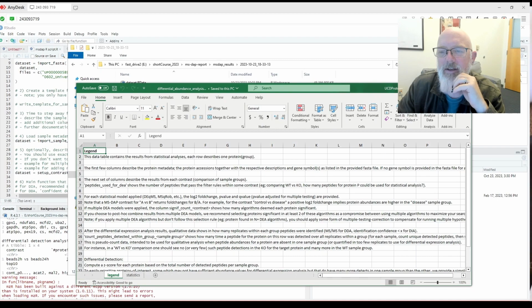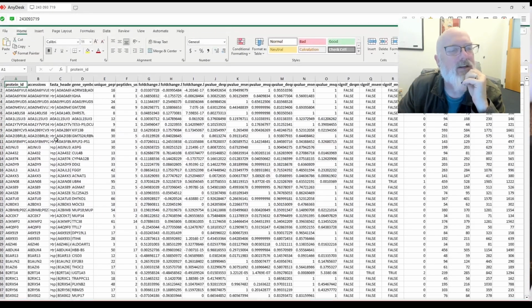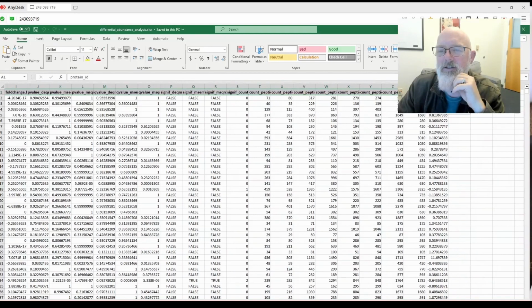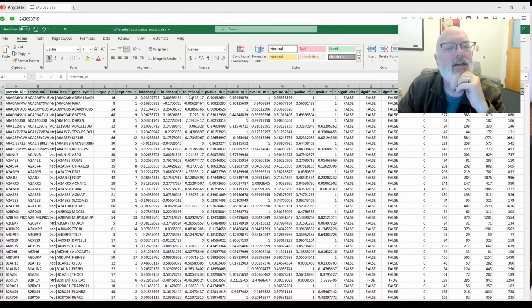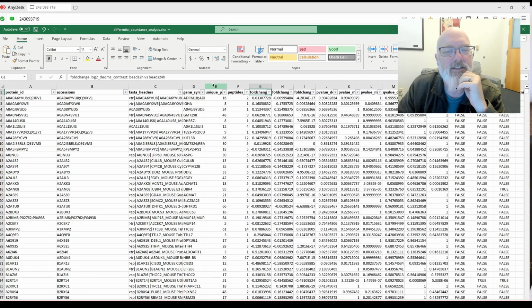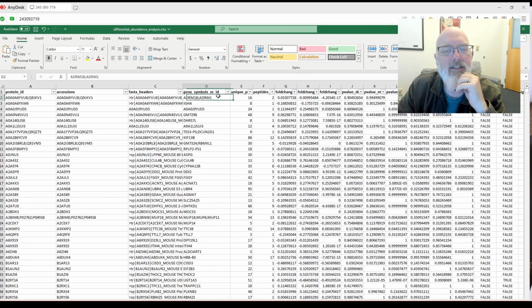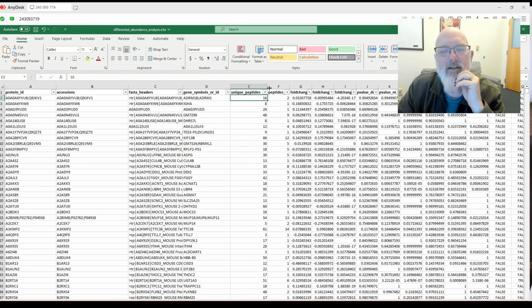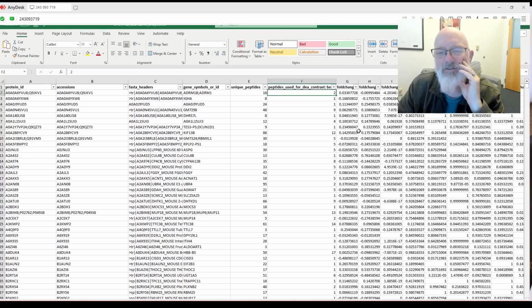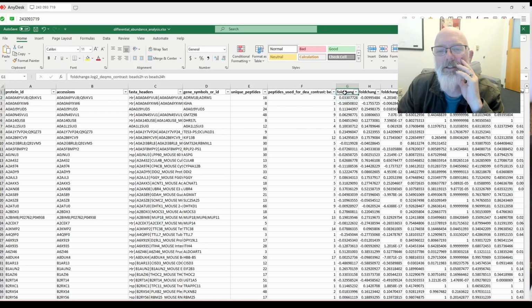Here is the differential abundance analysis. It has this nice legend, and the statistics are here, and it has a nice header in bold, which I like to filter. So we just go filter, and it looks like here are the protein ID, accession, some pretty similar FASTA headers, which is nice. Gene symbol. You can see it's doing protein groups, unique peptides used for DEA contrast. So these are the number of peptides used for the differential expression. Here's the fold change, log2 fold change for each algorithm. So DEqMS, MS-EmpiRe, MSqRob.